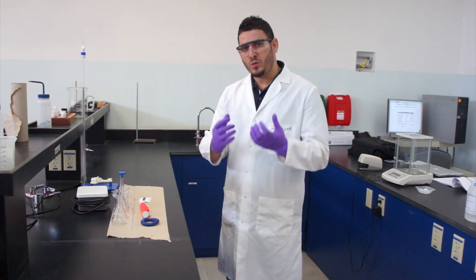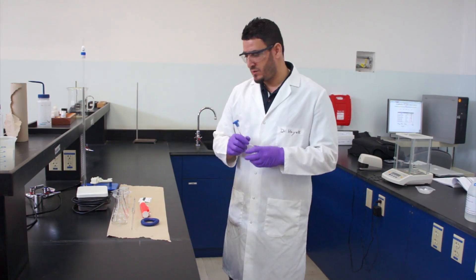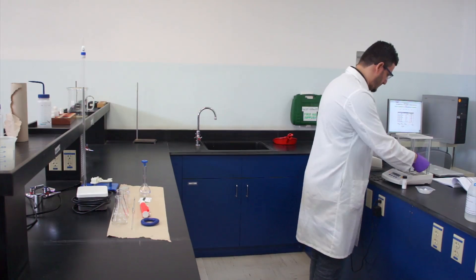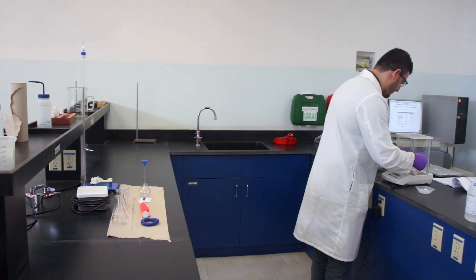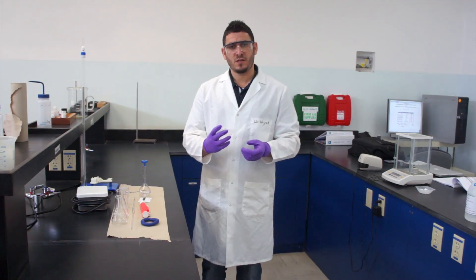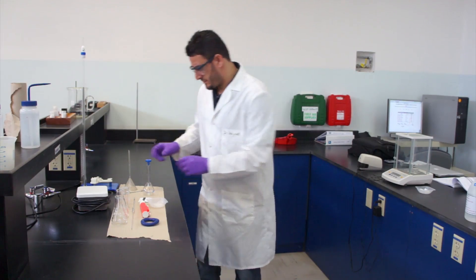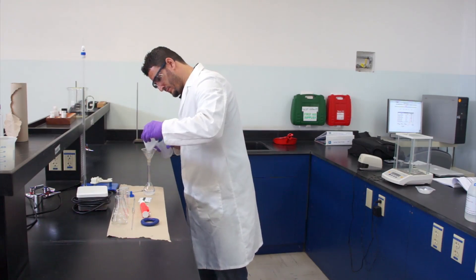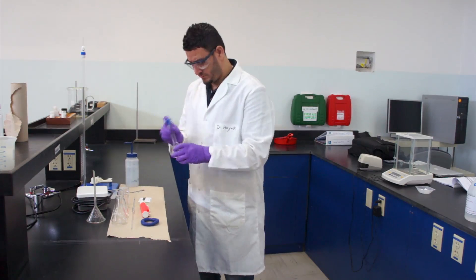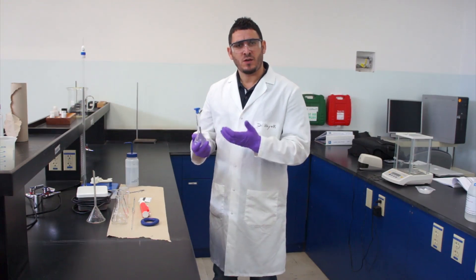Now that we know what we want, we will start the experiment by preparing the solution of the acid salt. I will be weighing around 1.5 grams. This is around 1.5 grams of the acid salt. I will now prepare the solution and set up the titration.